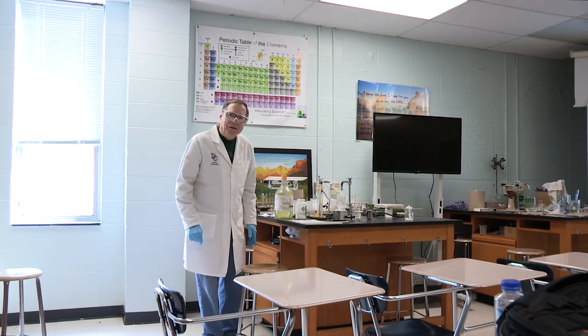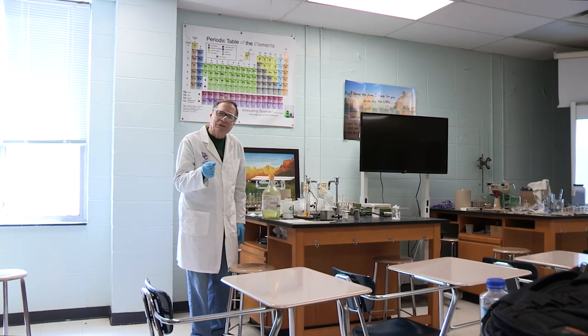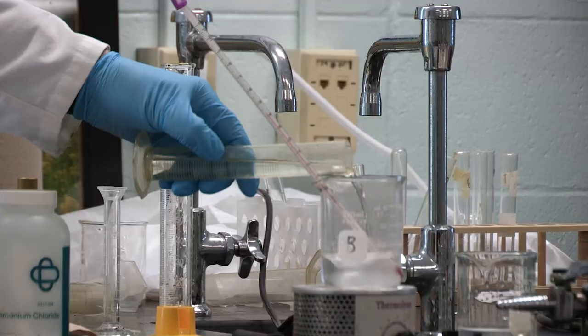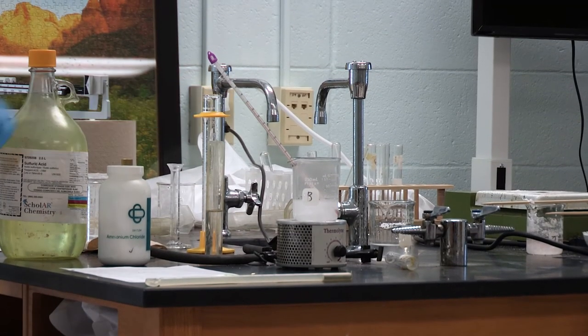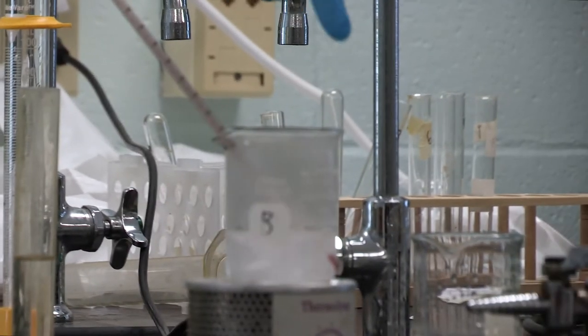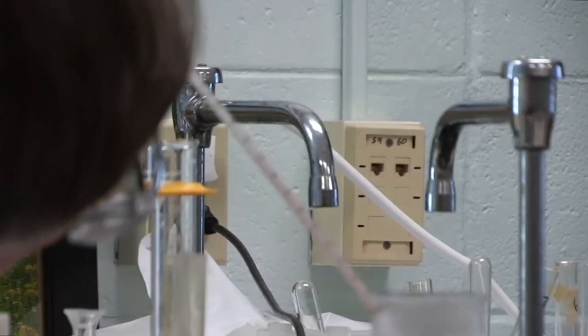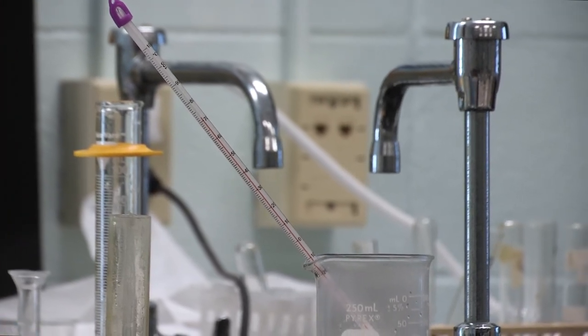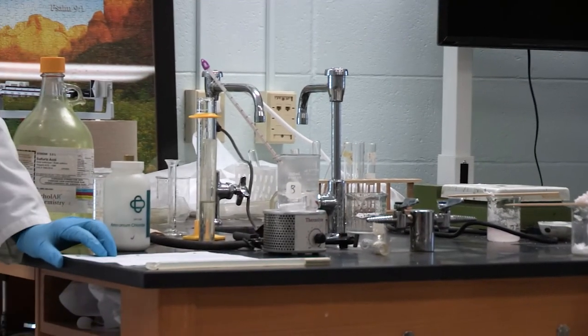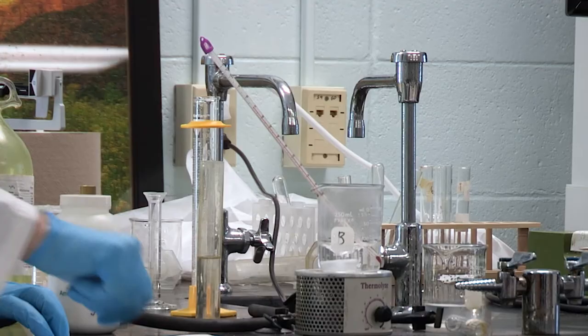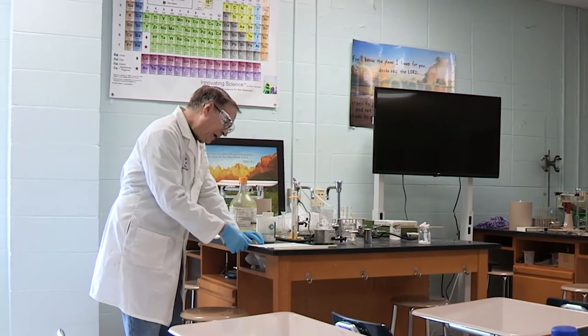Now I said I think I can make it boil. What is boiling temperature in Celsius? For water, it's 100 degrees. I think we can get it to 100 degrees. So let's add another 5 milliliters. Can you see steam coming out? And not only steam, but you can see the condensation inside the beaker. Let's see what happened. What would you say it is? I'm going to say about 72. We went up to 72. So what is that? 19 degrees. The first time we went up 15, second time 14, this time 19 degrees.